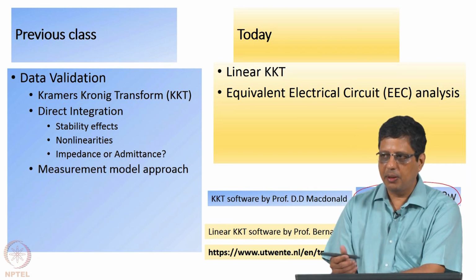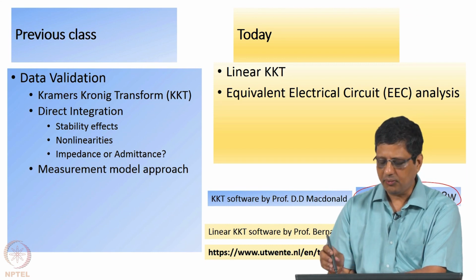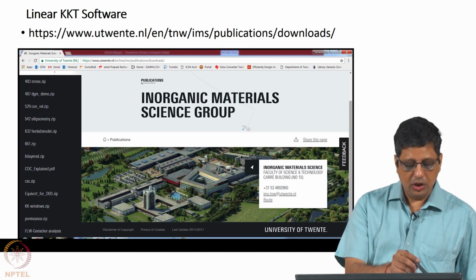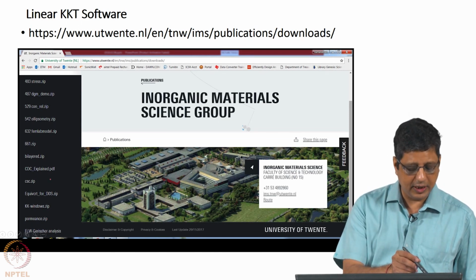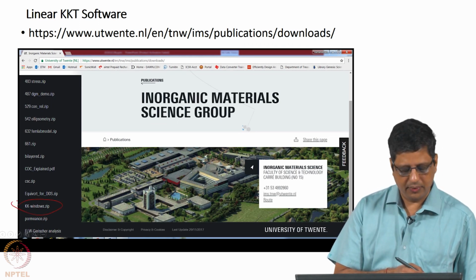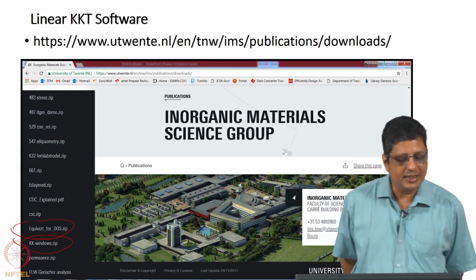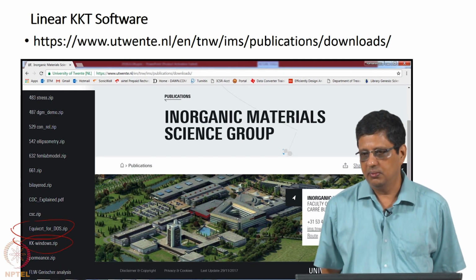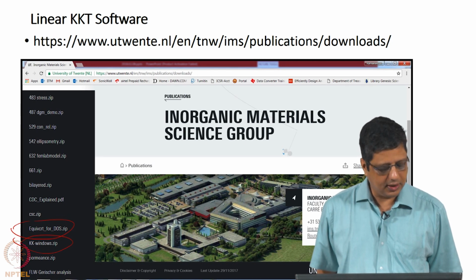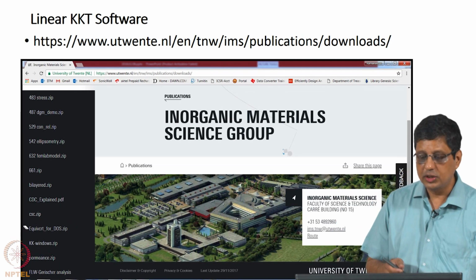This is available in public, so obviously you can download and use it, anybody else can also download it, right. So if you go there, just to give a screenshot of that, you would see a variety of programs and files on the left side. You scroll down, you will see kkwindows.zip, that is linear KKT. And there is another program called Equivalent Circuit for DOS. That is also something that you can use for circuit fitting, for analysis. It is not meant for KKT analysis, it is meant for what we are going to see subsequently.